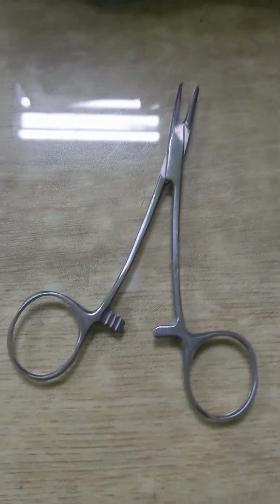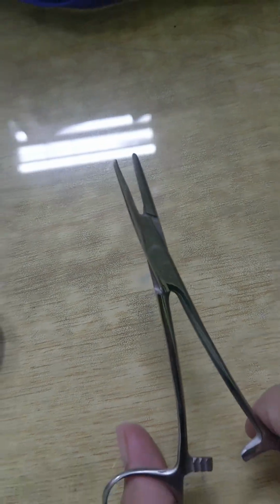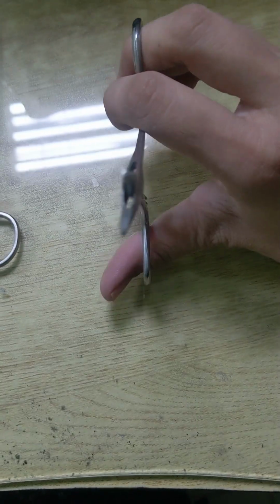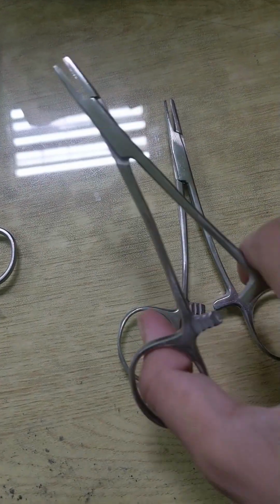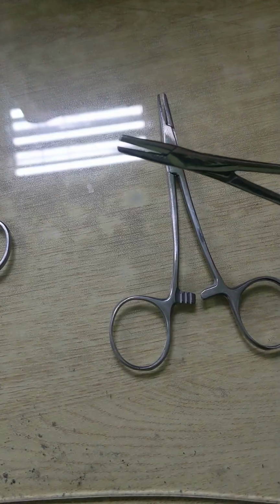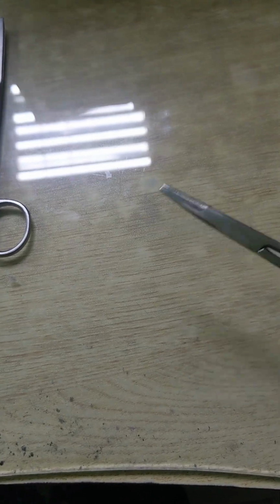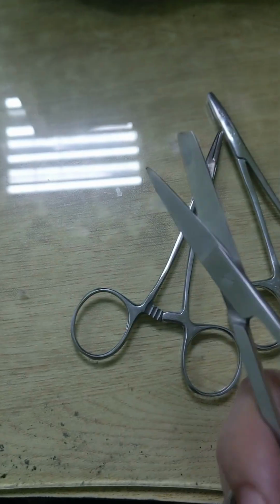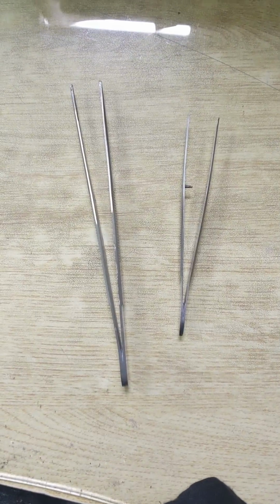Suppose the structure is very small and you can't manage with your fingers, then you will use this forceps scissor. It will help to pick up small structures that are very difficult to handle with your fingers. Its structure looks like a scissor, but it's actually called forceps. In simple words, you can say artery forceps, because it looks like scissors, but it locks and holds the tissues just like this. You can hold and lock the tissues, arteries. So it's not purposely used for cutting, but used in surgery and advanced dissections to handle blood vessels and tissues, and to grasp. So these are three kinds of scissors and forceps that are used in surgery.